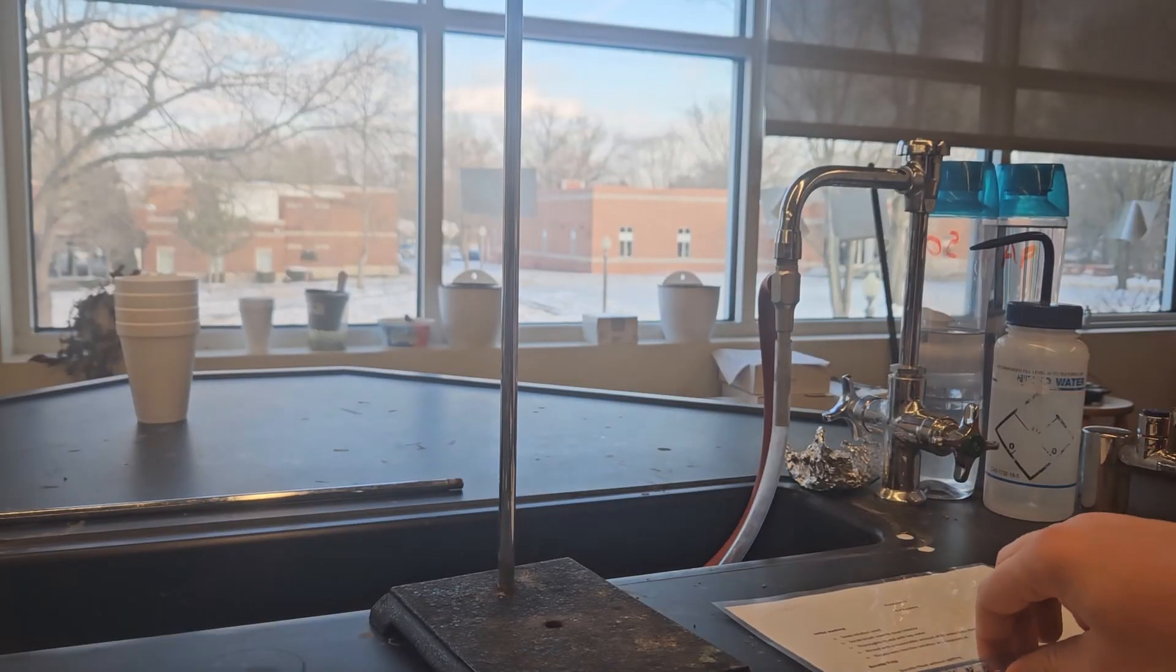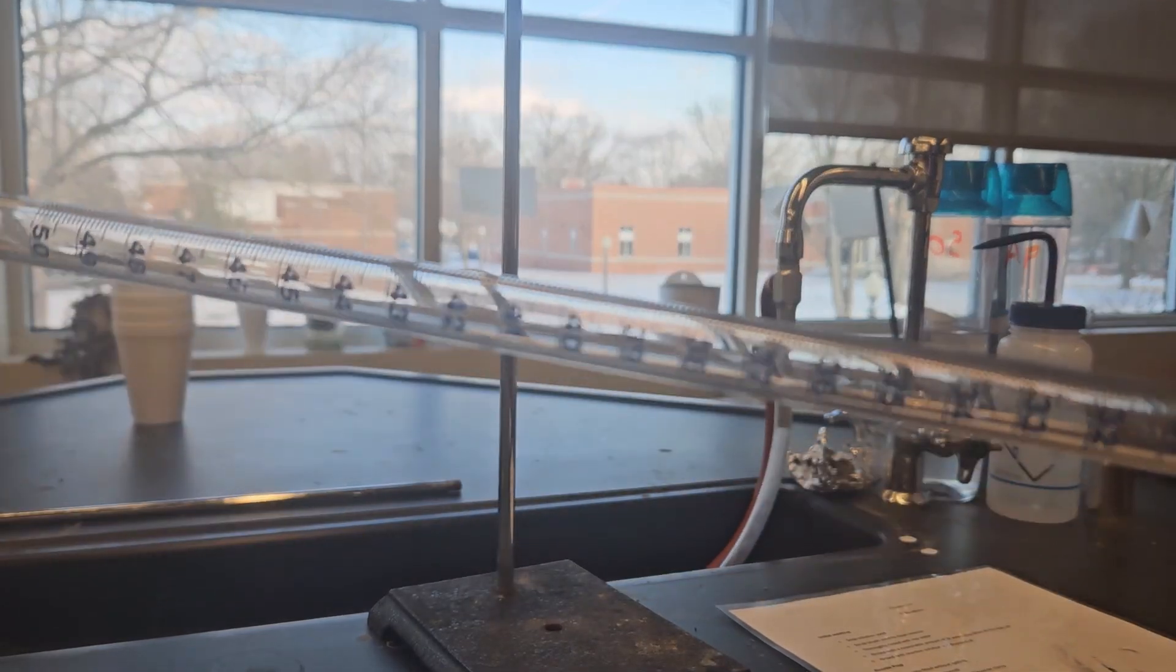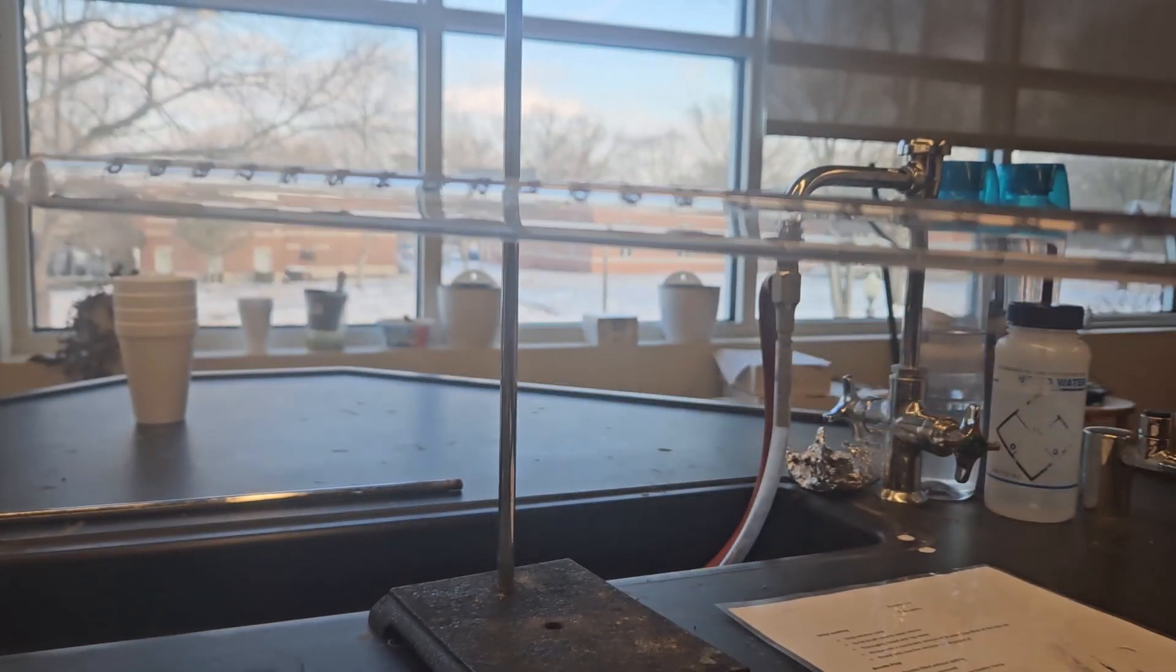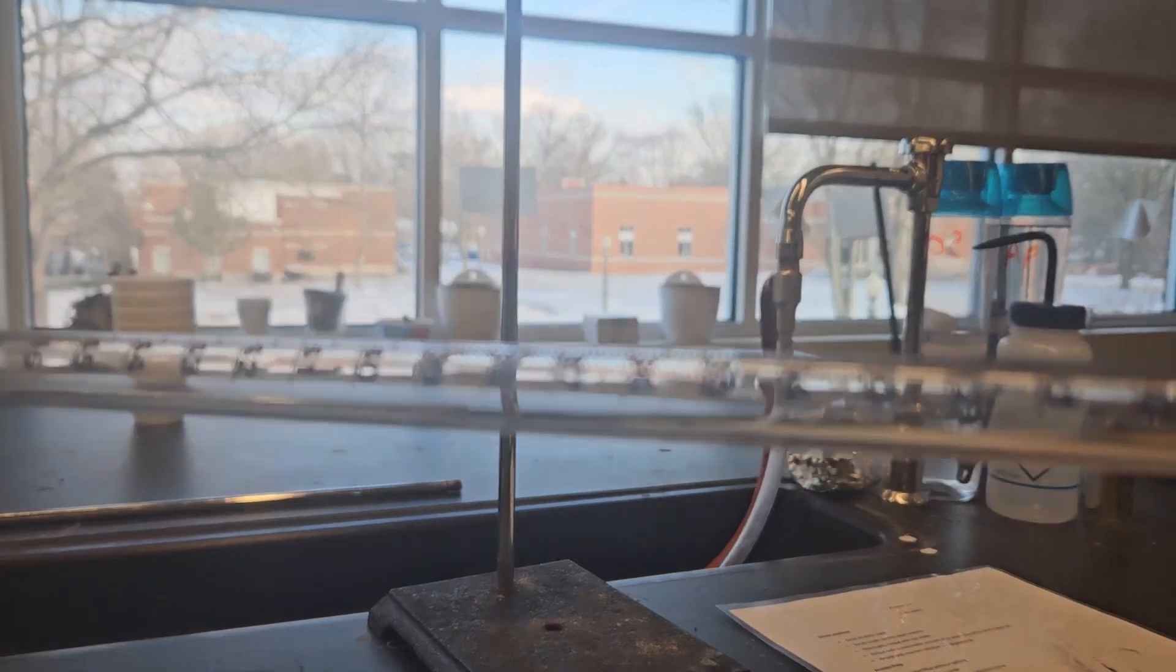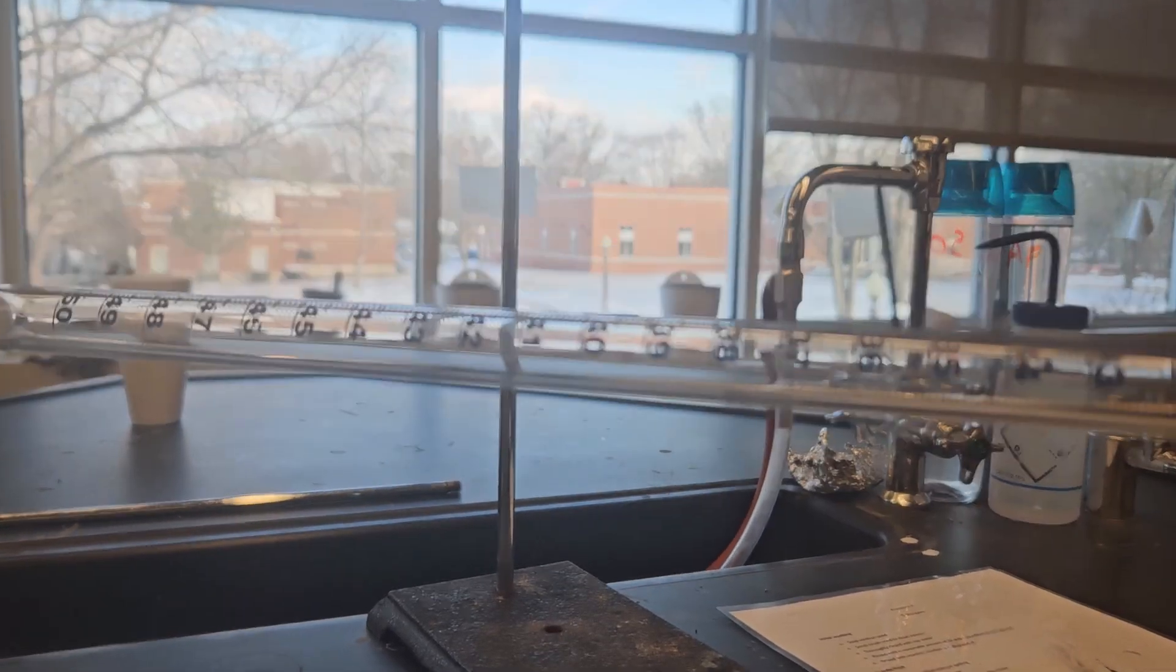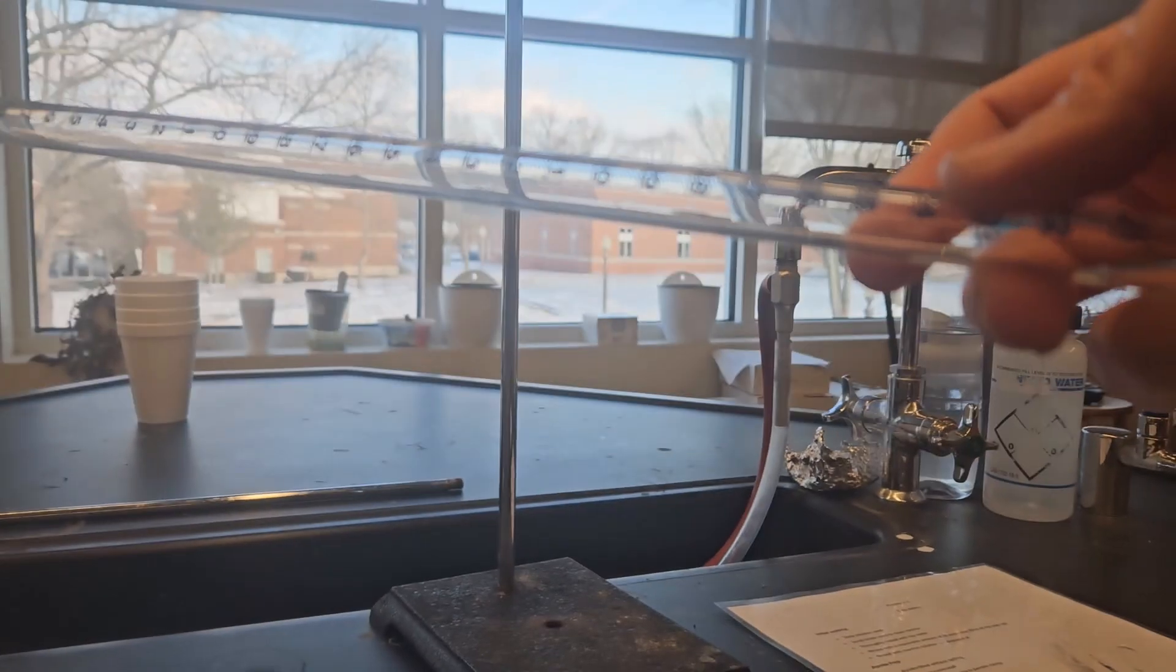Howdy folks, so today I'm gonna go through practicum number three, the video of the cleaning and the burette prep and using the burette. So without further ado, first step is cleaning the burette. If you're actually cleaning glassware, we should do this in a stepwise fashion, the first step being using a soap solution and scrubbing it.